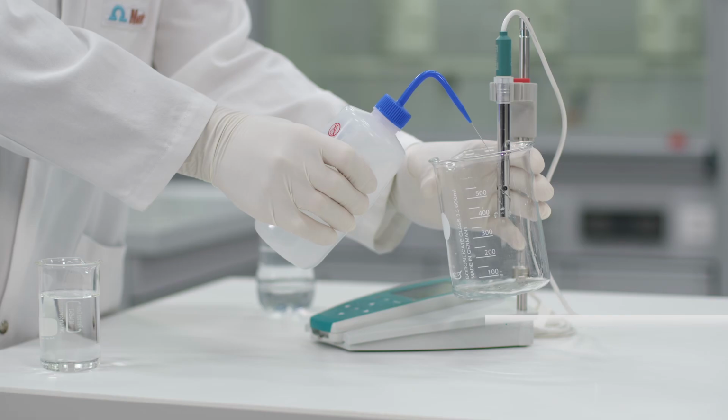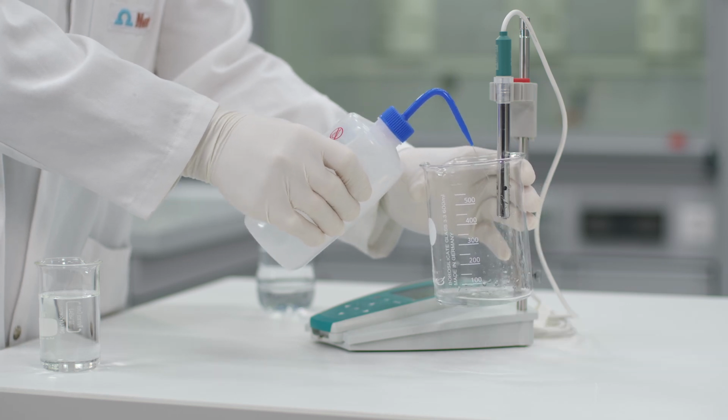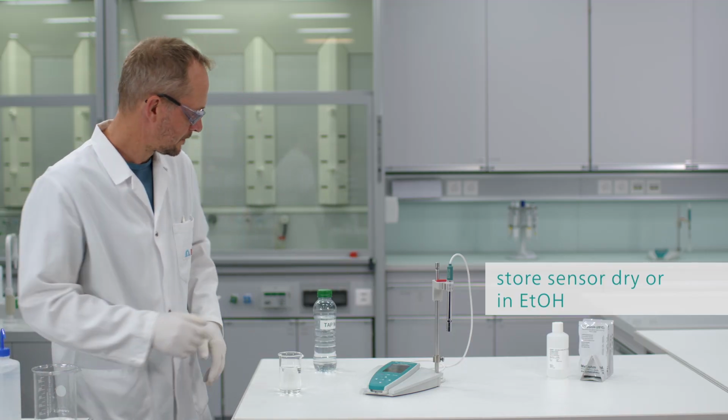After the measurement, rinse the sensor well with deionized water or a suitable solvent. When not in use, store the sensor dry or in ethanol. These were the basics of conductivity measurements.